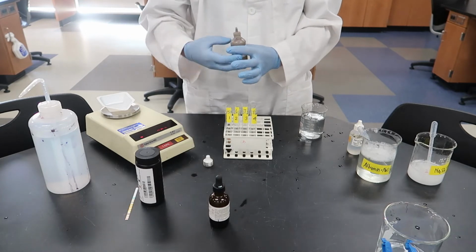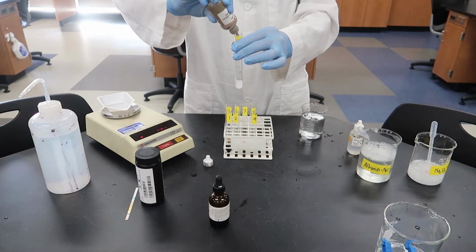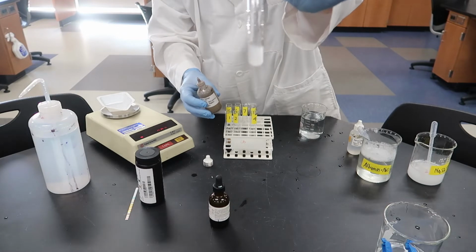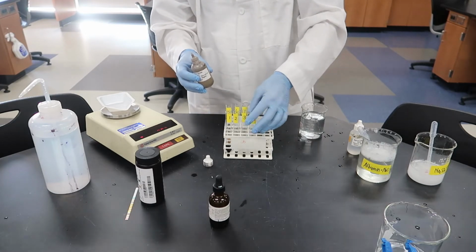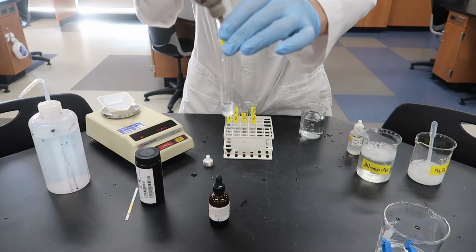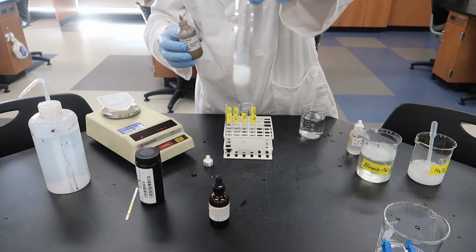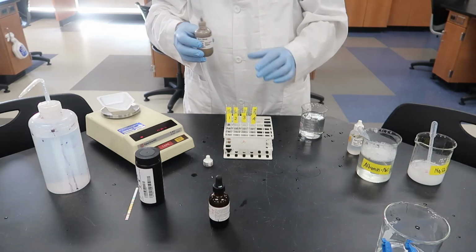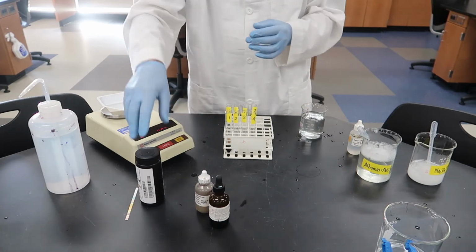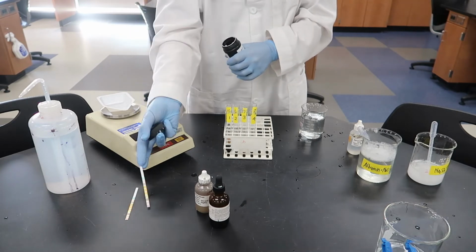Alright, now we're going to switch to the silver nitrate, AgNO3. We'll add a couple of drops of that to each of the test tubes 3 and 7. Okay, we added a few drops in there and didn't really see much of a change. We'll add a few drops to that one. Oh, look at that. As soon as we added the drops, it turned as cloudy as milk. And that was the white precipitate that forms because silver nitrate tests for chloride, and test tube number 7 contained sodium chloride.